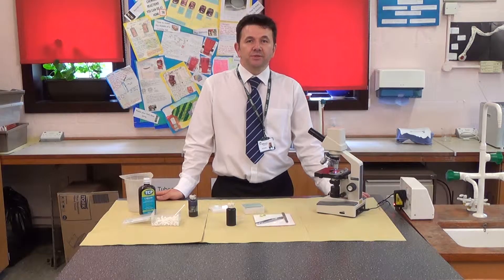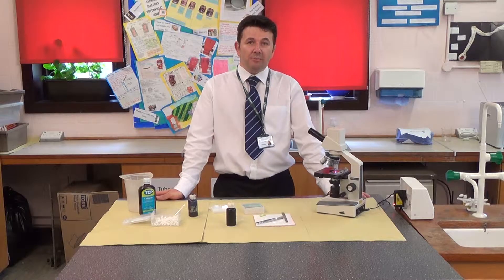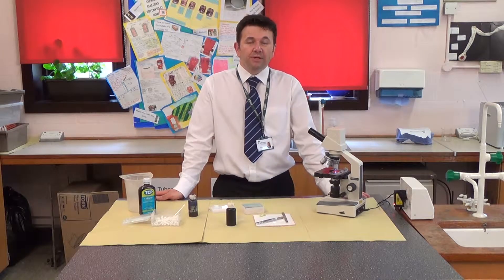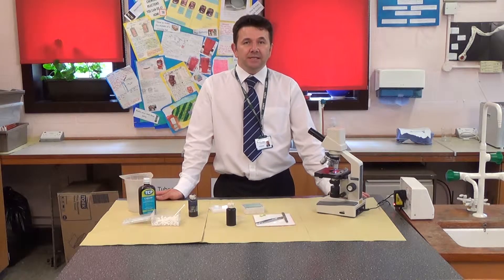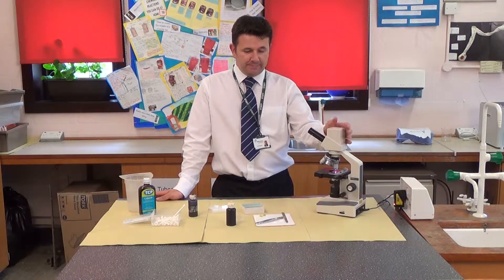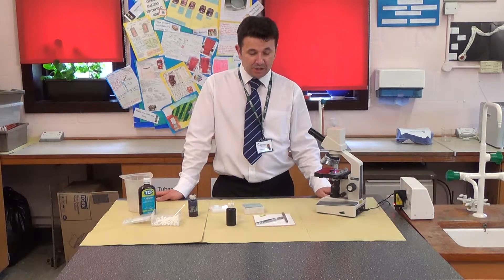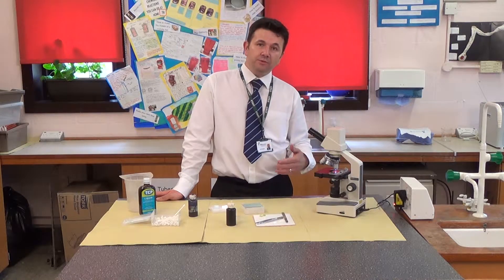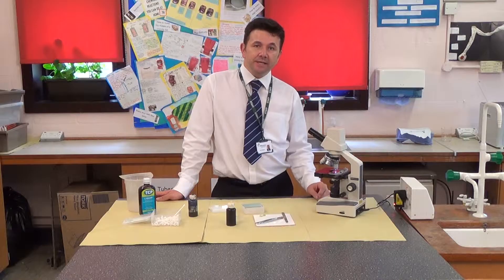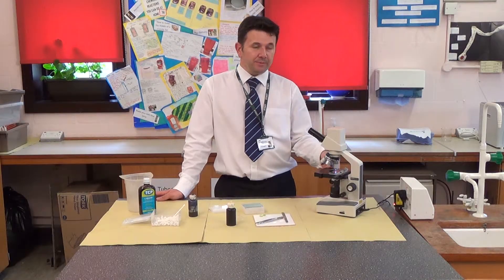Hello, welcome to GCSE Biology Required Practical Activity 1. This is related to microscopy. What I'm going to do today is show you how to produce a slide and how to use the microscope.